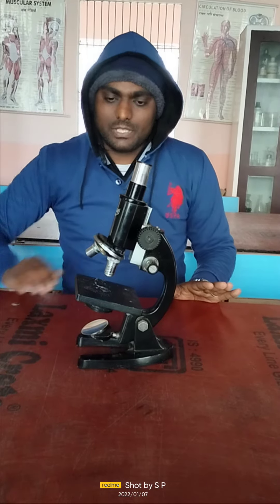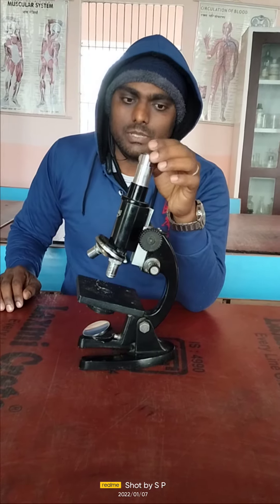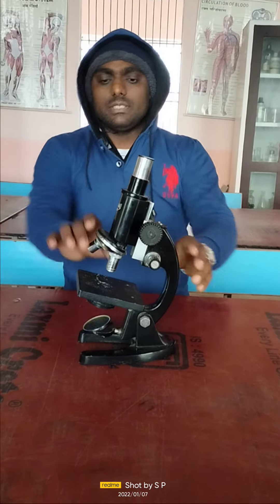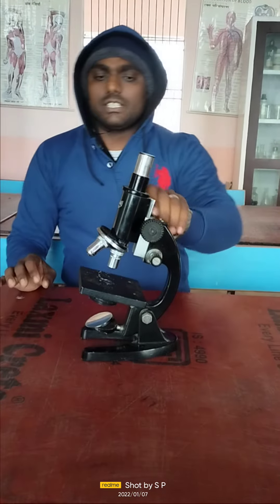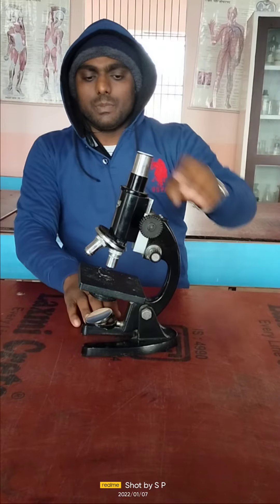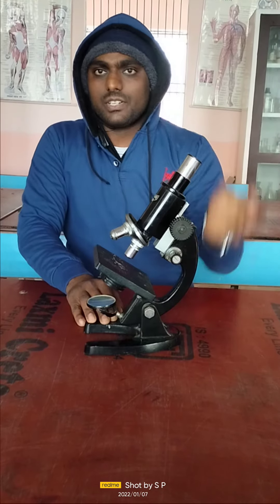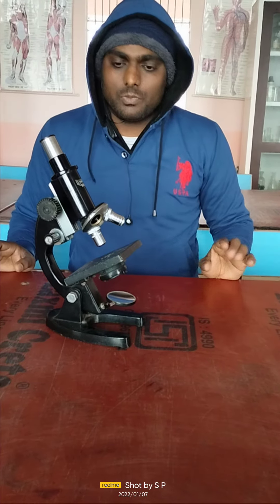This is the eyepiece of different resolutions which may be used for observation. This is the lens which is adjusted for the specimen, and this is the adjustable point from where we can adjust the eyepiece at the proper distance from the specimen. This may also be adjusted as per the direction and presence of light, moved forward or backward, and in this way we can use this compound microscope to observe different specimens or small things.